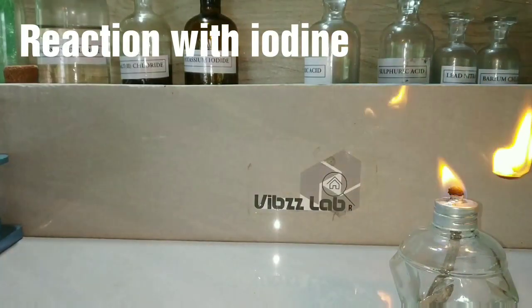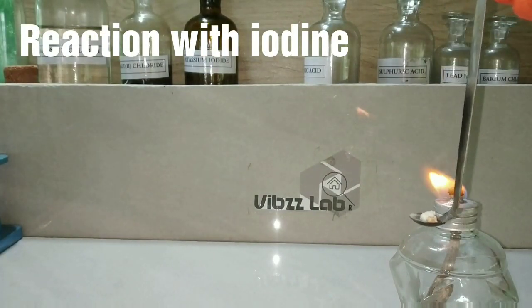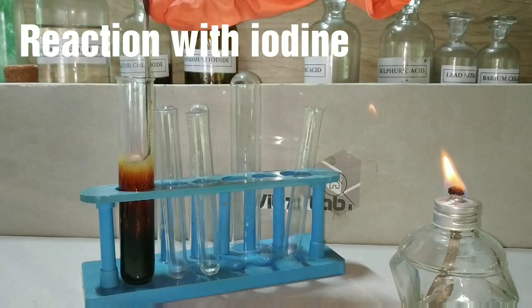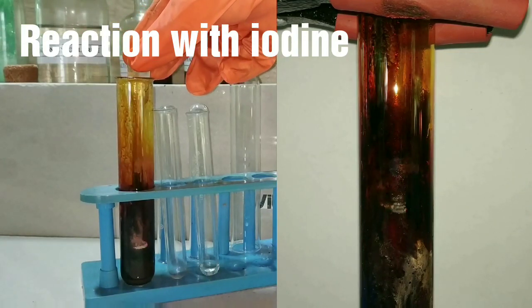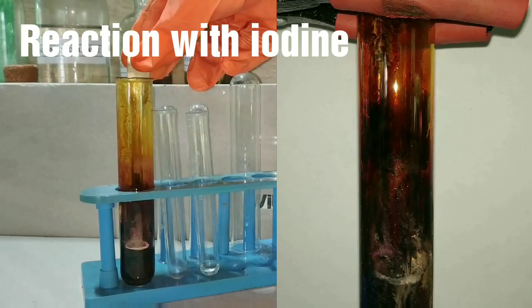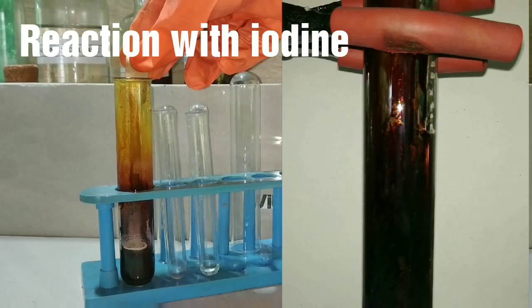Now I am heating a piece of sodium metal. The melting point of sodium is 98 degrees. On reaching about 290 degrees, there is auto ignition of sodium metal, which you just saw. On introducing the piece of sodium metal into iodine, there is a reaction taking place which is also exothermic, but the reaction is not as exothermic as with chlorine, and this reaction produces sodium iodide.